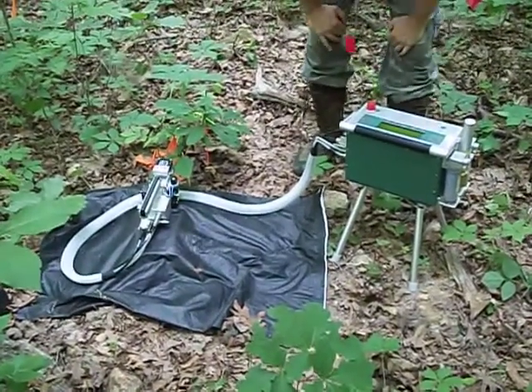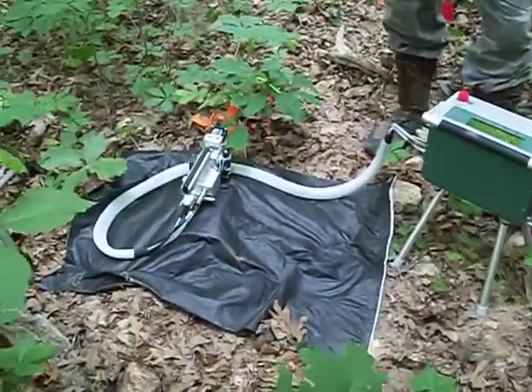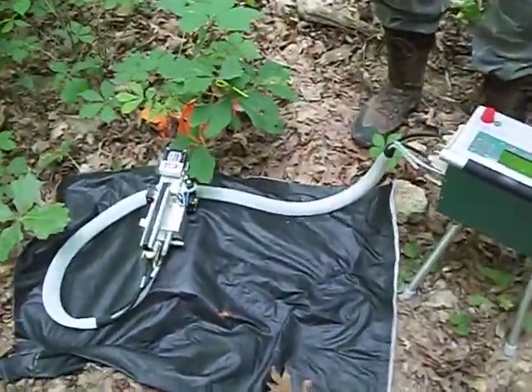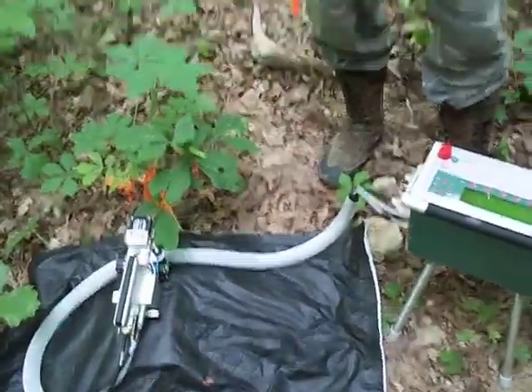I know it looks like we just carjacked Ecto-1 and that we're playing with the toys we found inside, but this is using a gas exchange meter to measure photosynthesis in the field. And Extension Forester and PhD candidate Kyle Cunningham is going to explain how this all works.